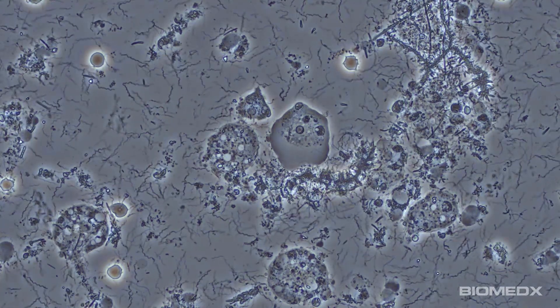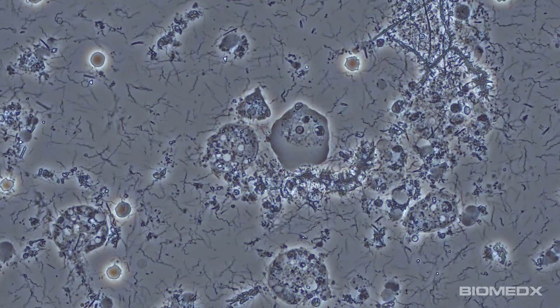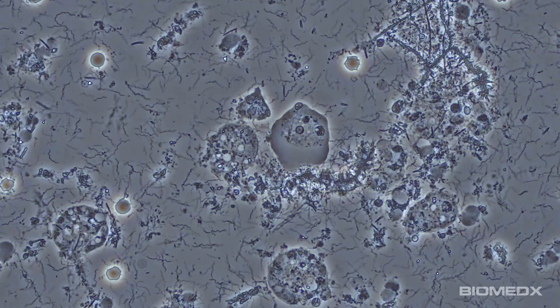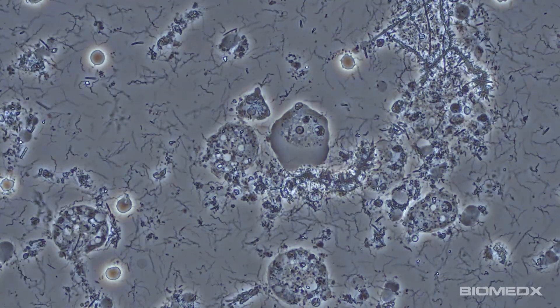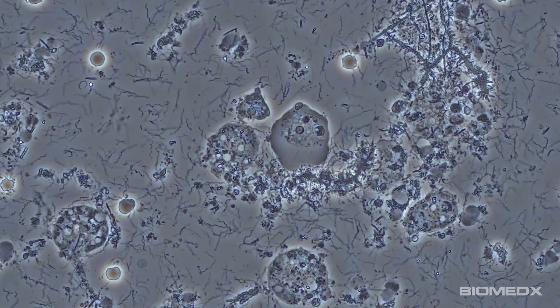Spirochete invasion — this is what it looks like under the microscope. When this gingival sample came up at a recent workshop, a returning attendee shared her story from an earlier class.